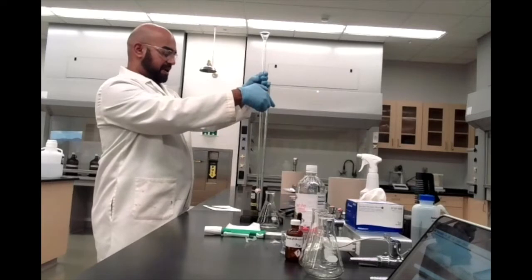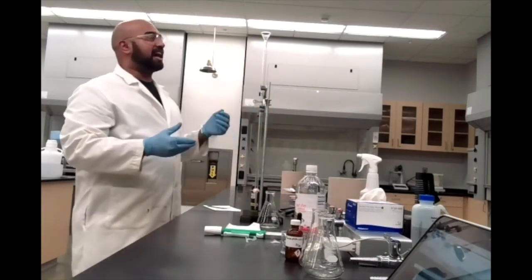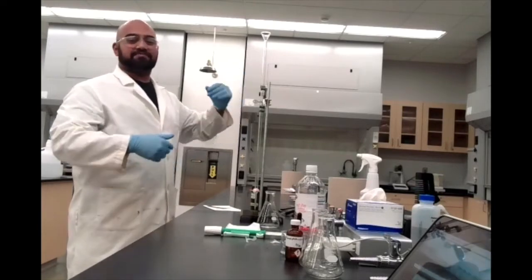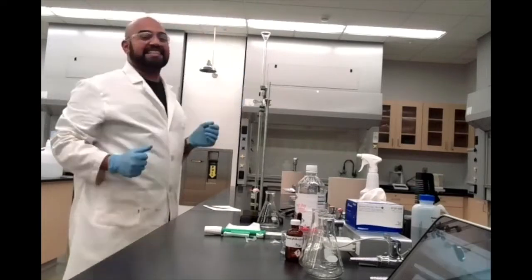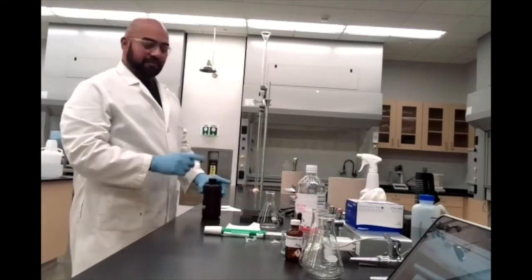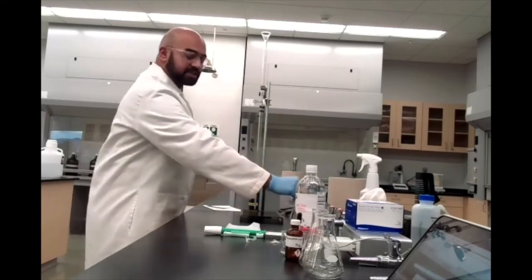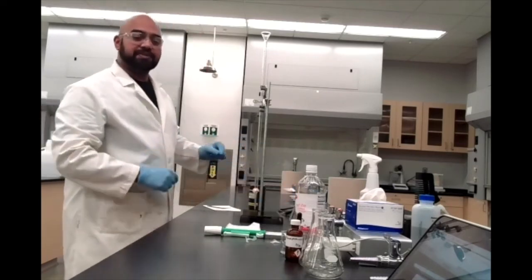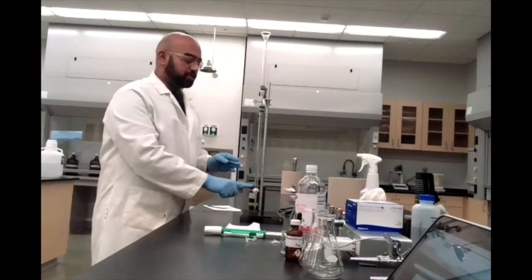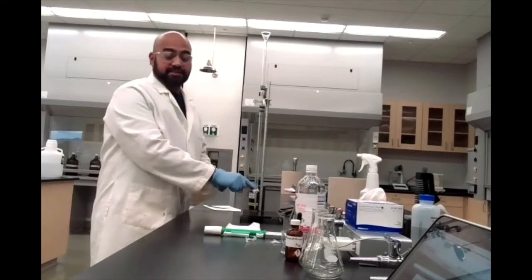Okay, so I recommend, at least when pouring sodium hydroxide into this, you have this a little bit lower. It's a lot easier to pour than standing on your tippy toes and pouring like that. Probably a lot safer too. So, of course, make sure that the stopcock is closed. I don't know if you guys can see that. There we go. Hopefully that should be visible. But when the tap is perpendicular to the glass tube of your burette, that tells you that this is closed.